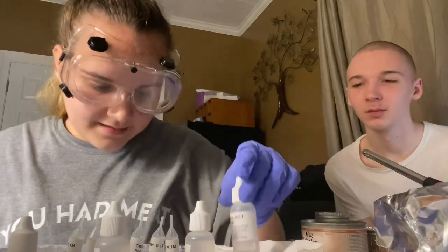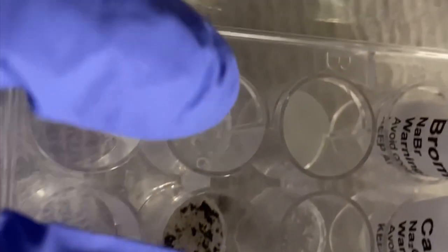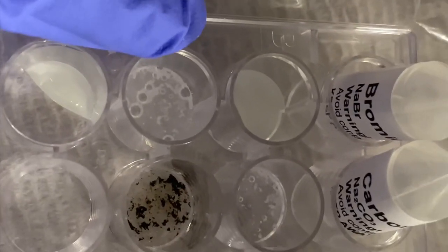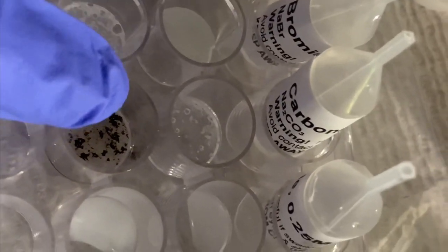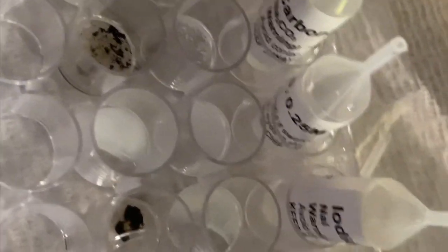And now I think I know the identity of both of these. So here are the results before we added the 2 drops of hydrochloric acid, and here are the results after we added the drops of hydrochloric acid. The identity of substance 103 is carbonate, and the identity of substance 104 is sulfide.